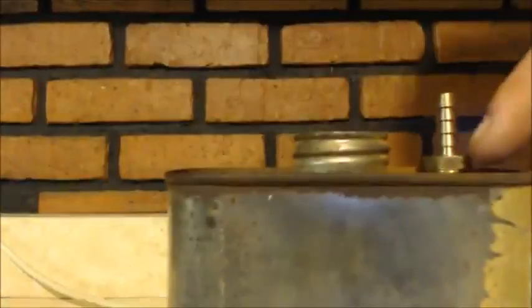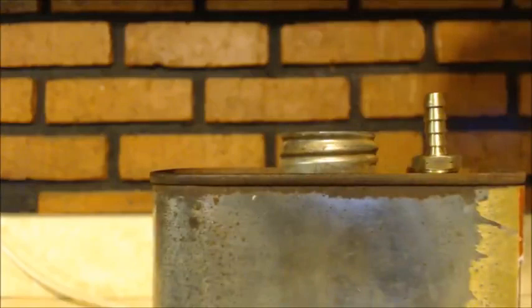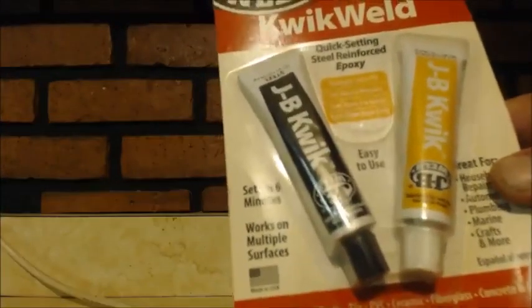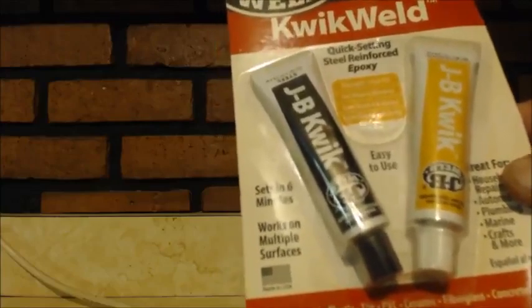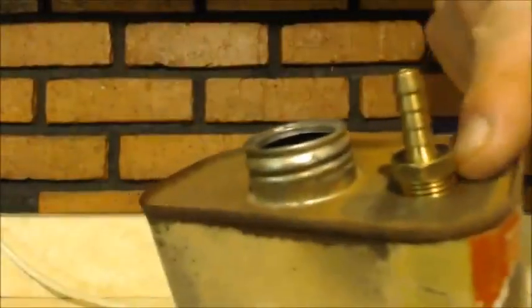Basically, JB Weld that right along here. So I figure the cap is airtight. I'll get back to you after, because you have to mix these two together, and then they harden. But before they harden, you hurry up and put it on your seam, your hole, your crease there, and weld that up basically.